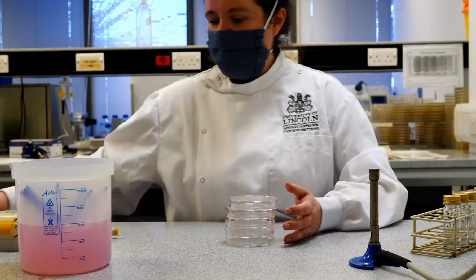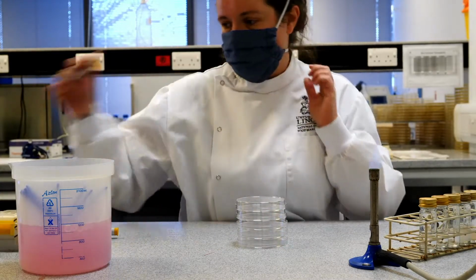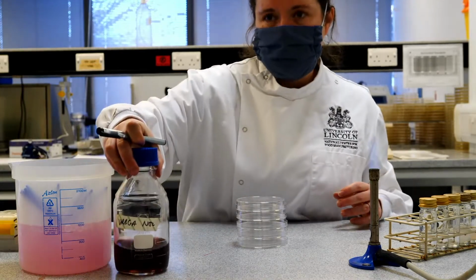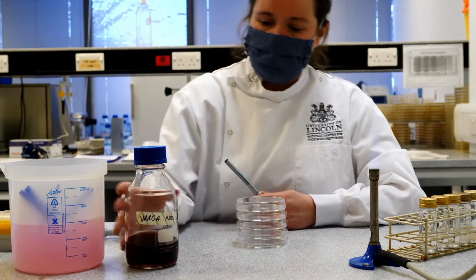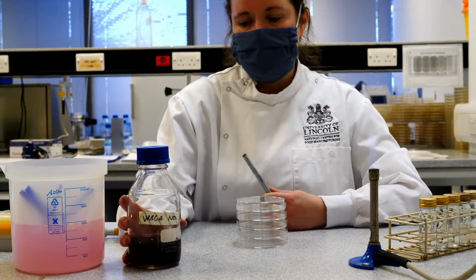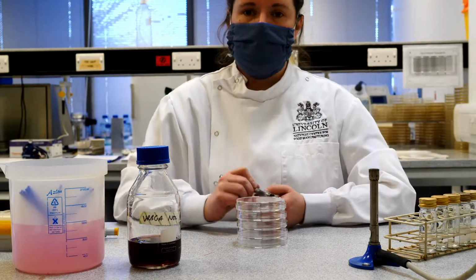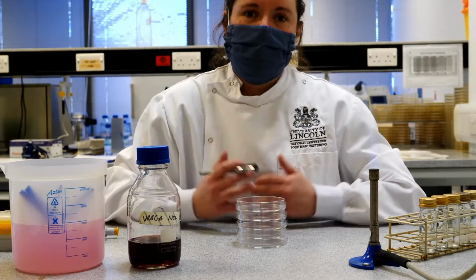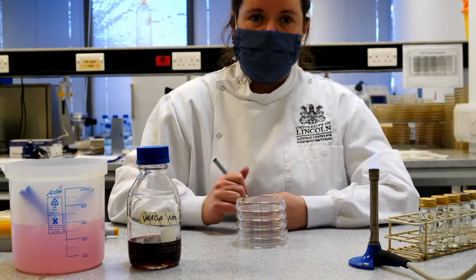And then the last technique we're going to look at today is a slightly different type of technique, but again using microbiological growth media. And this is a technique known as pour plating. And what we're going to be using with this is a molten media called VRBGA. And this medium is really good for the growth of Enterobacteriaceae. So these are organisms like E. coli, which grow within the gastrointestinal tract of animals. They also, though, are really dangerous in terms of food poisoning.